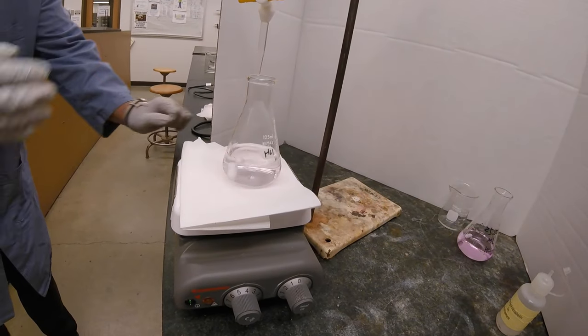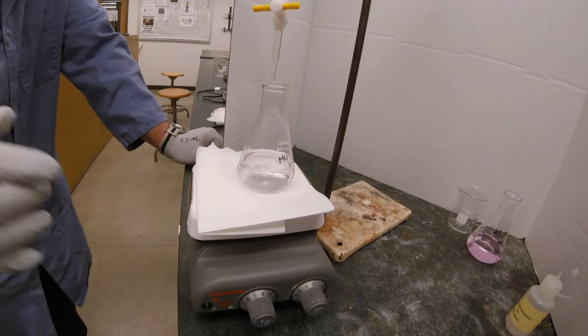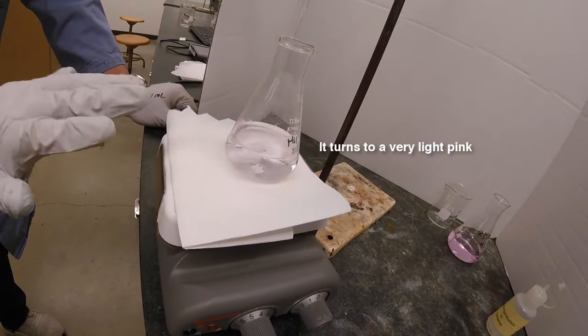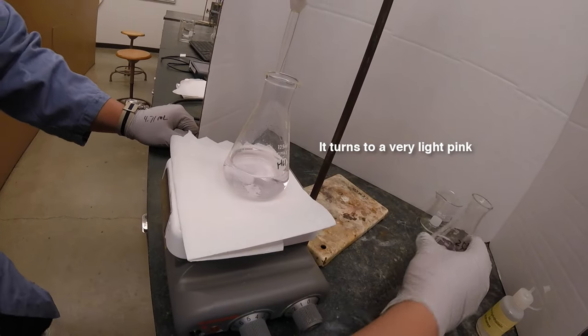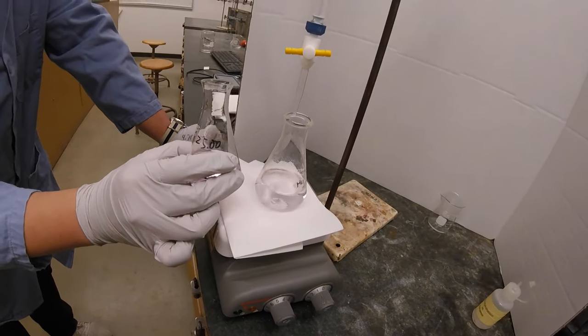Right now, as you can see, I've added one more drop, and this is a pretty light pink. It's kind of hard to tell, but that's why we have the paper towel here to show the color contrast. If you were to compare with this overshot one, you can really see the difference between the light pink and the dark pink.